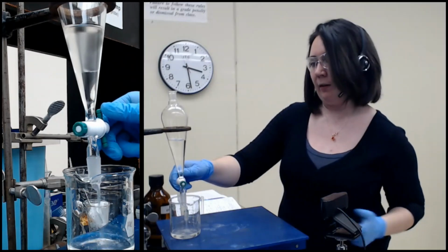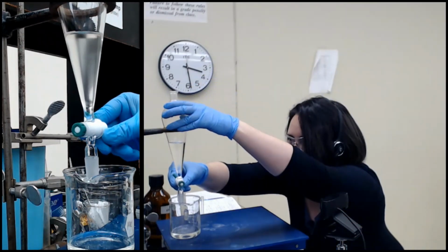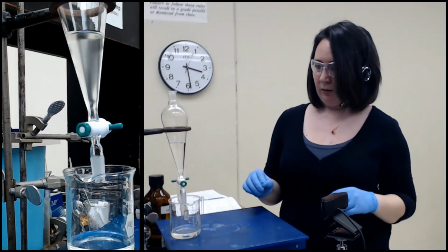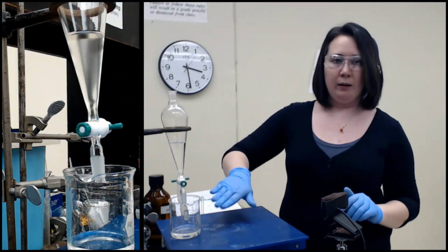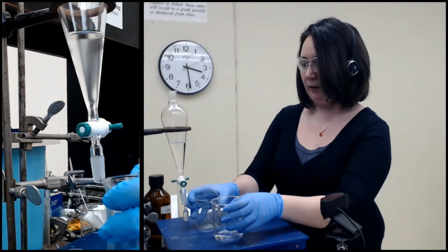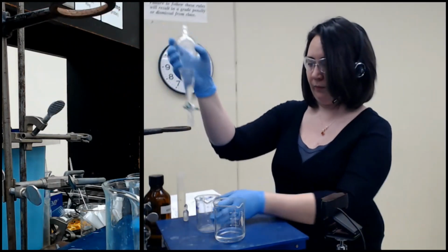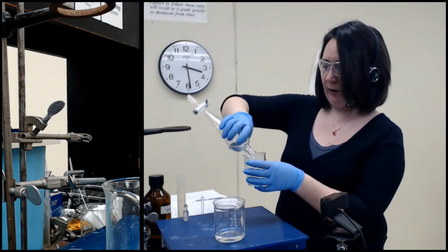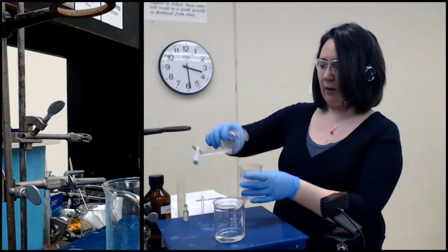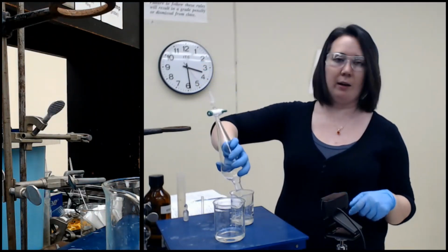Now, sometimes it gets clogged or something, so there can be other reasons, but okay. So organic layer, aqueous layer. I'm going to put my organic layer back in the beaker it was before. Notice how I'm pouring out the top because I don't want it to mix with the water that drained in through the bottom. So you drain your bottom layer and you pour out your top layer.